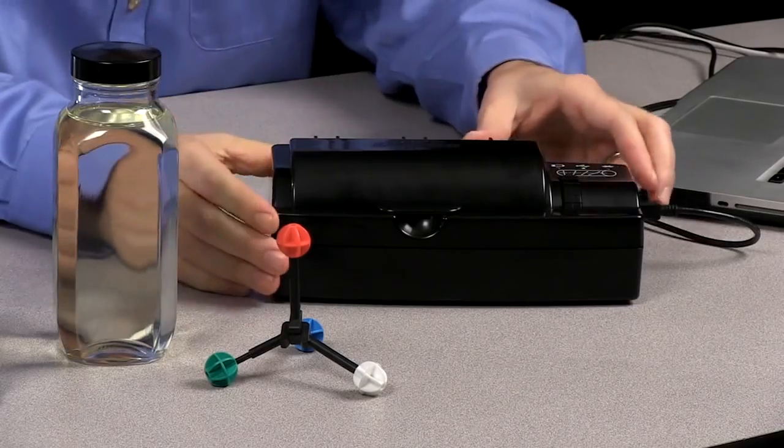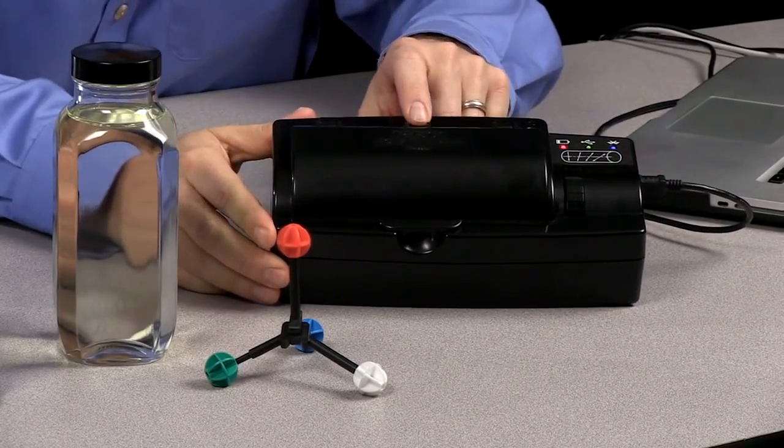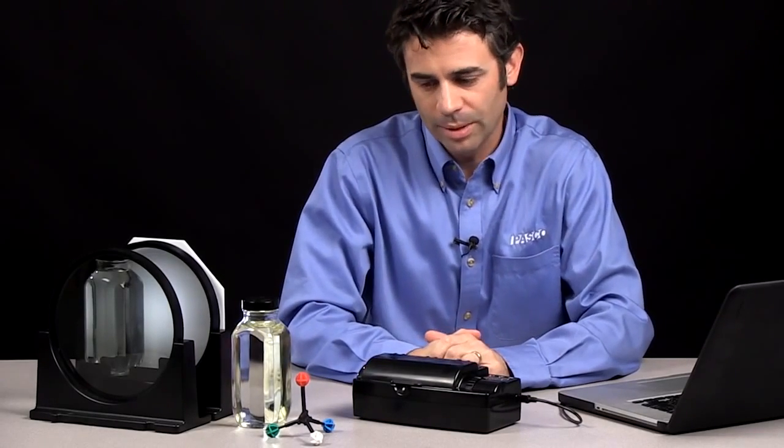Hi, I'm Tom Loschiavo, the Chemistry Education Manager at PASCO Scientific, and I'm here today to talk about the PASCO polarimeter. So the polarimeter is a device used to measure the rotation of plane polarized light by optically active compounds.